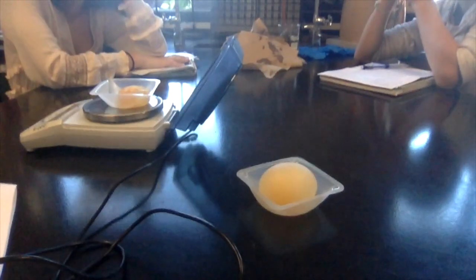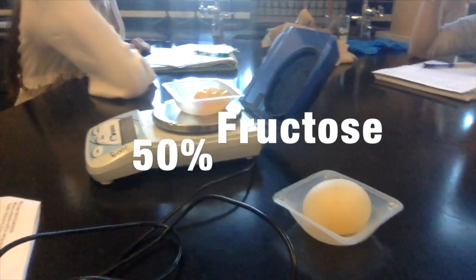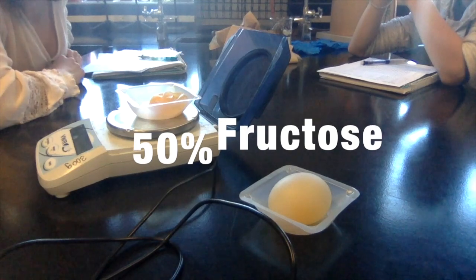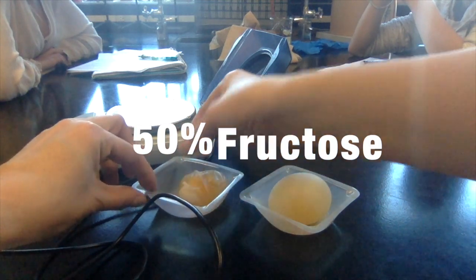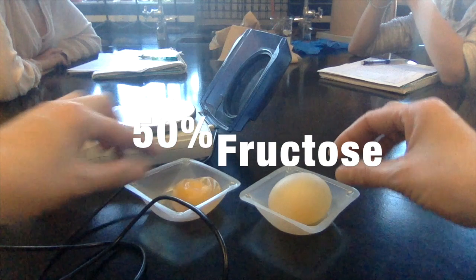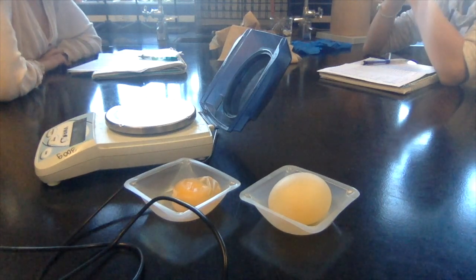We want to compare what happened, what are the after effects? Is it smaller, bigger? The egg is a little bit smaller, and it has white kind of on the outside. I think the white is just left over from the calcium from the shell. And it's really soggy. What about your solution? Because you had 50%?